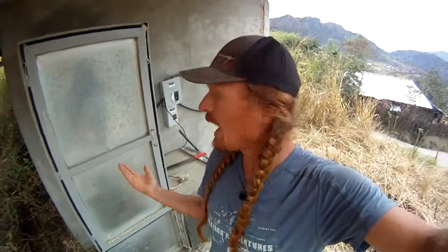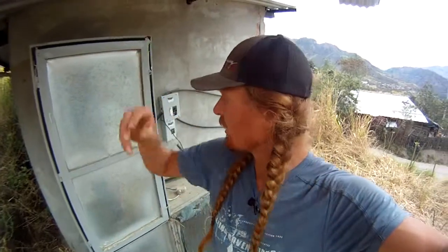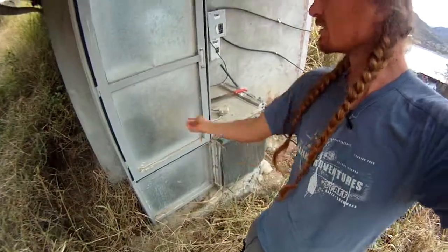All right, so this is the backside of my laboratory. The main crux of an actual mushroom operation is your laboratory. If you're a home grower, you don't necessarily need a laboratory, you can order spawn from somebody who has one, like myself. But I have a lab, and I'm gonna show you how we use it and how we start. One of the main apparatus is your air filtration system. The lab is basically a clean, sterile environment, keeping out all these baddies, mold, bacteria, fungal spores that are floating around the air. This is a filtration system that is pumping in clean air. So I'm gonna show you what that entails, and I'm gonna clean it and get it back in operation.